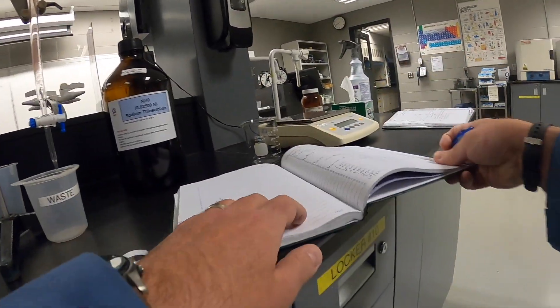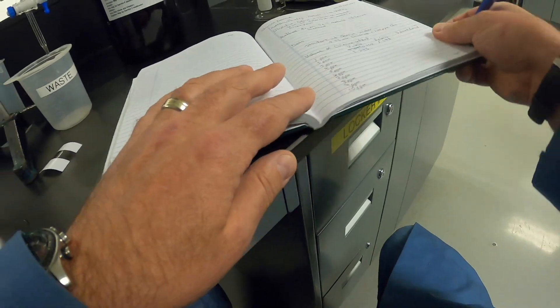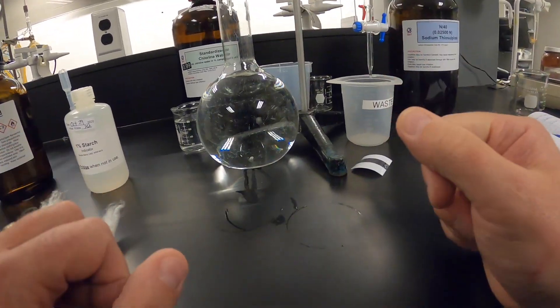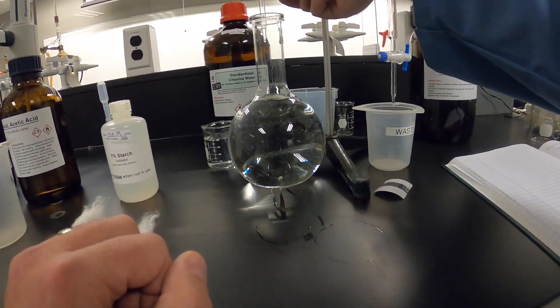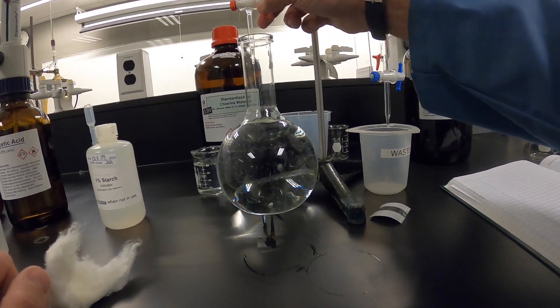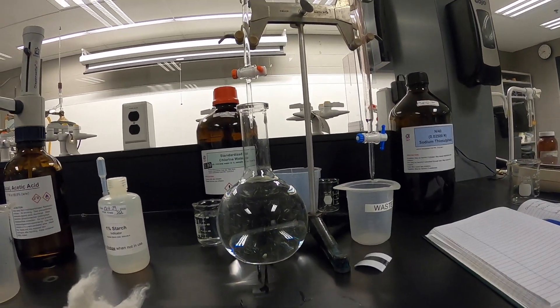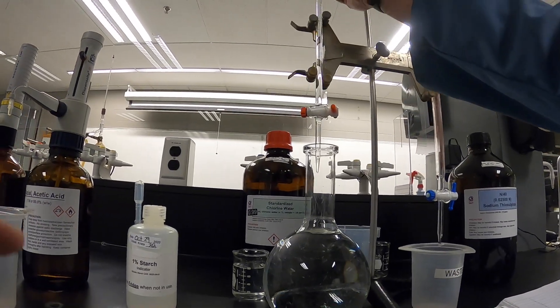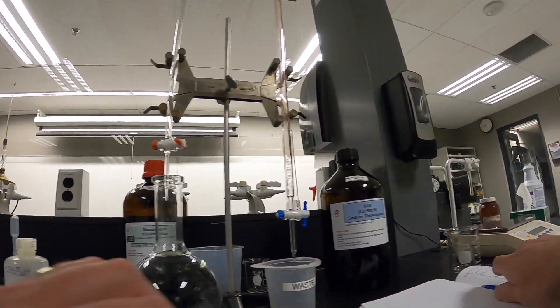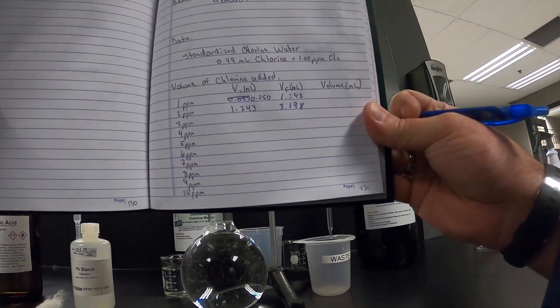I don't need to read the initial volume again because I'm not going to change it. Now I'm going to add 2 mL. Ian has started the stopwatch, and this volume is 3.198 mL — that's my second volume.